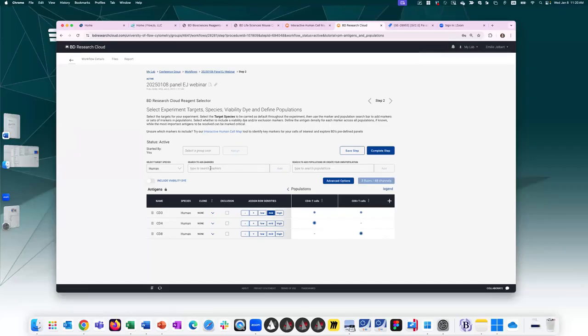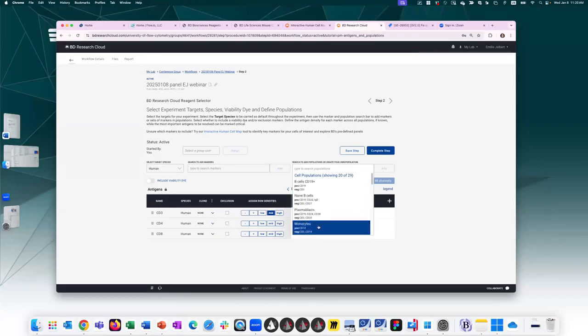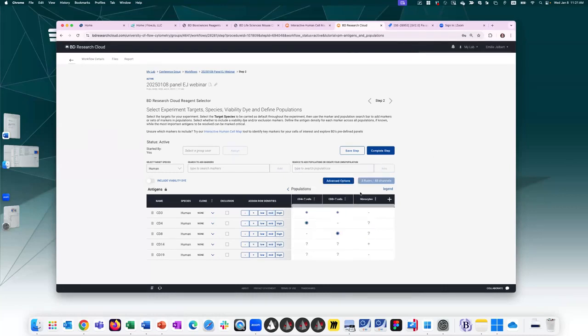So I could continue with additional markers, let's say CD14, and add it slowly here, or I could use one of those predefined populations. In this case, monocytes. Monocytes have been predefined by BDRC as being positive for CD14 and negative for CD3 and CD19. So if I select this population and click add, what happens is that it adds this new monocyte population to the population table, and it also adds any markers that weren't already there. It includes antigen density information based on its definition. So it added CD3 negative for the monocytes and CD14 positive, CD19 negative for those markers that were a part of the definition of monocytes. For any additional markers, it left it as unknown, so question mark.